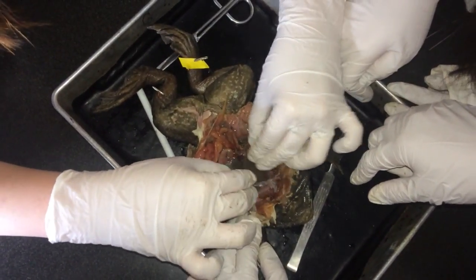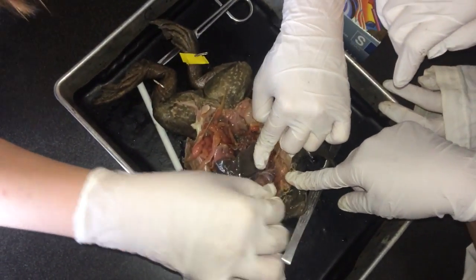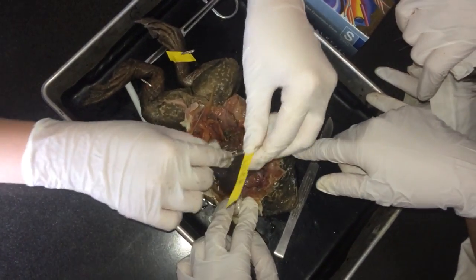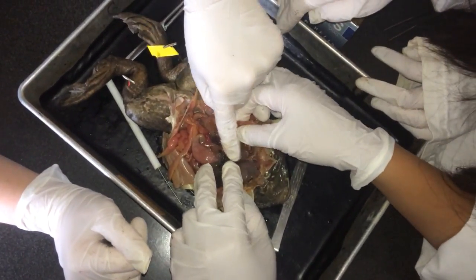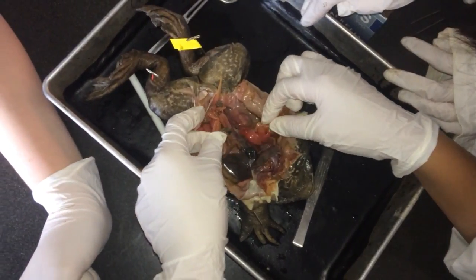And then the heart is right here. Wow. Okay, liver, heart — where is it? Should we pin it at the very end? Maybe, yeah. Gallbladder is here. Gallbladder. Spleen?